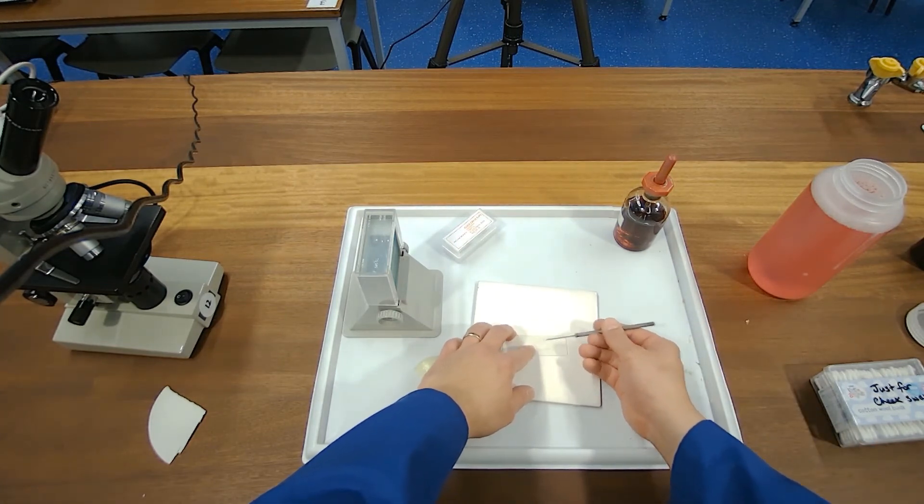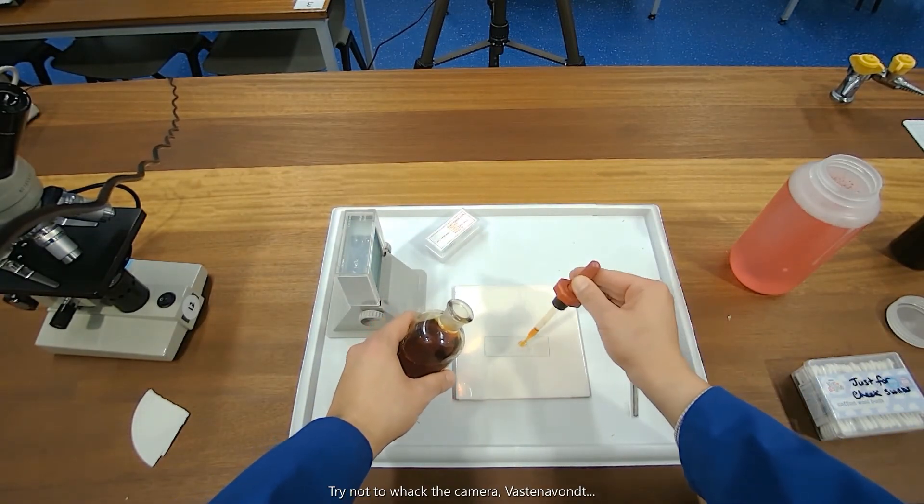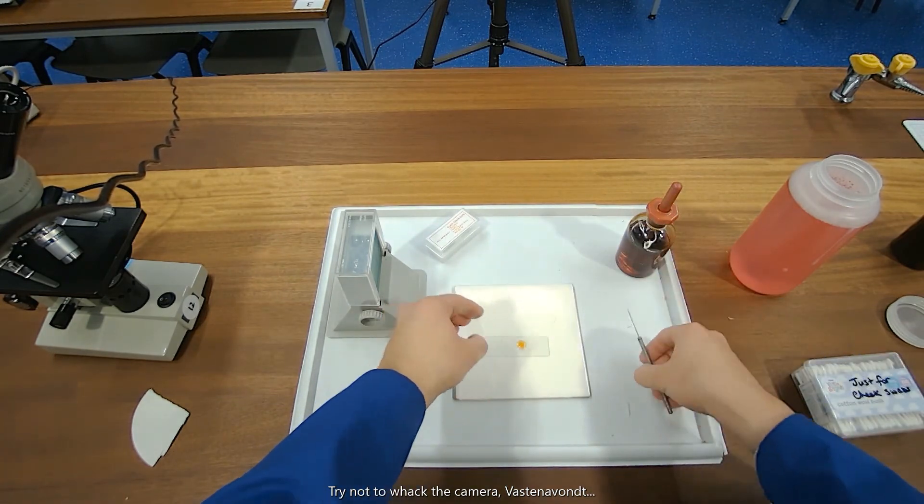A couple drops of iodine. Approach. Lower gently with the thing to reduce air bubbles being made. And voila.